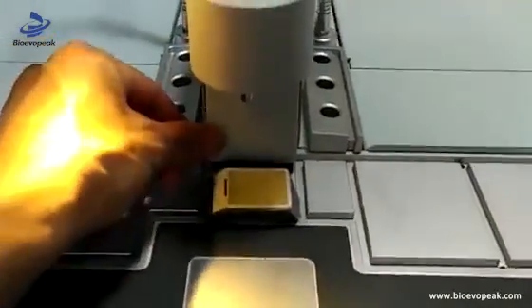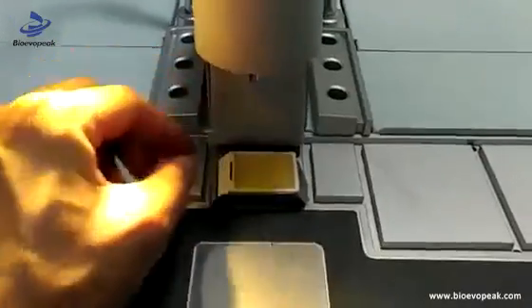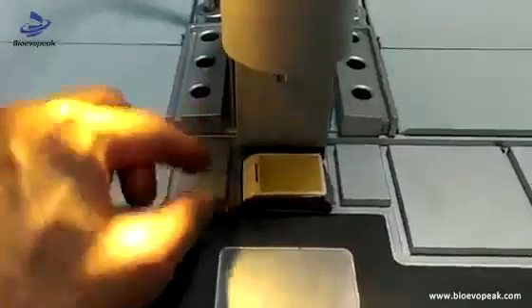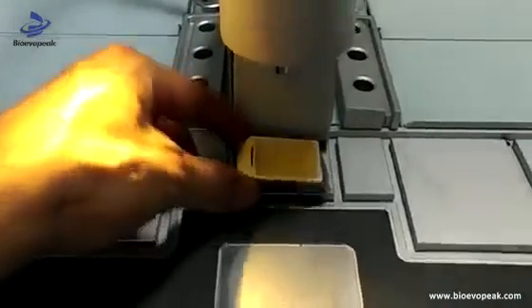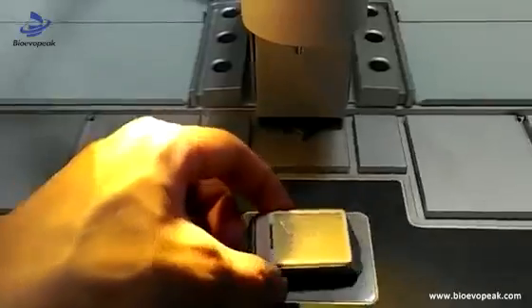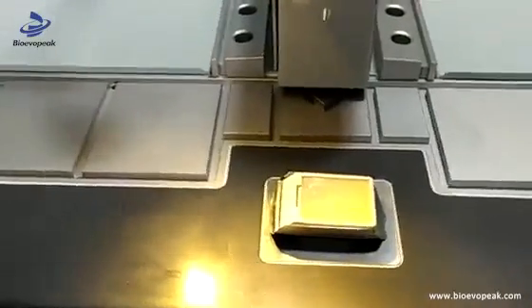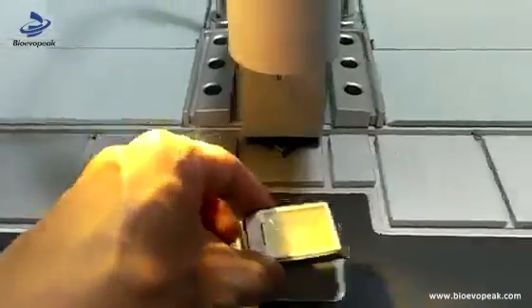By pressing the paraffin mode key, the paraffin liquid can flow down to the cassette, then we can make embedding here. After embedding, we can put the cassette onto the cooling table. Just a few seconds on the cooling table and the embedding is complete.